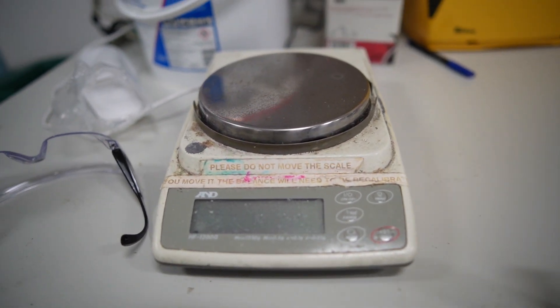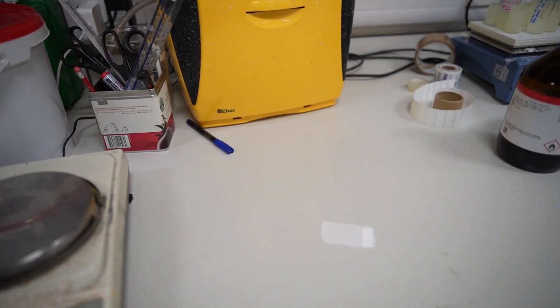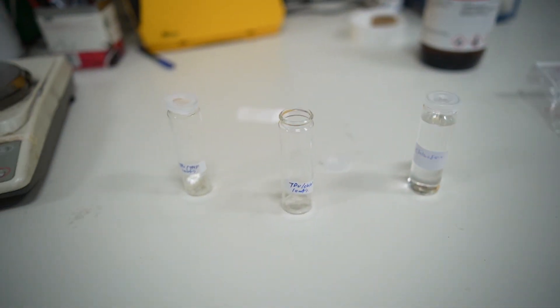I've already weighed them on this scale and plopped them in. Because it's cold, this polymer has become quite brittle — you can hear it's quite glassy as well. Right now I'm going to put some chloroform into this and I'm going to need 12 milliliters.